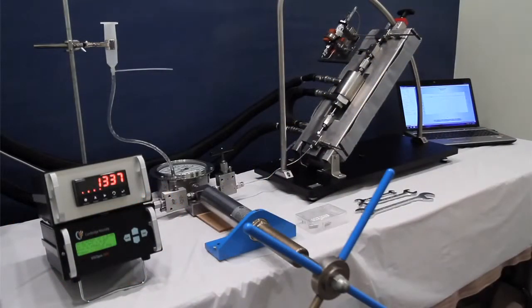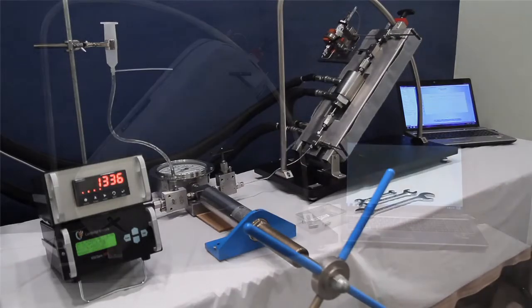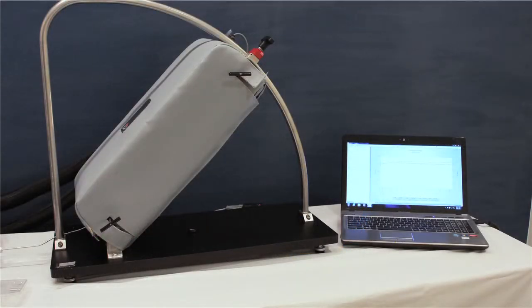Now that your system is connected and holding pressure, please reinstall the top insulation cover. Now we can begin taking measurements.